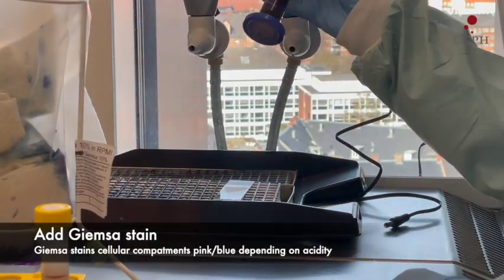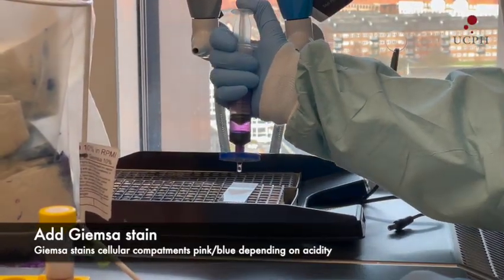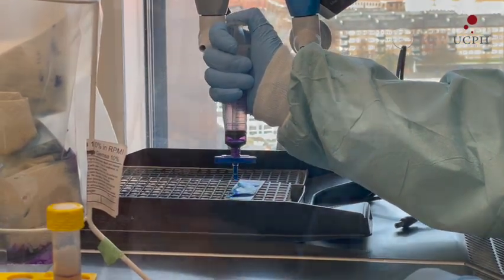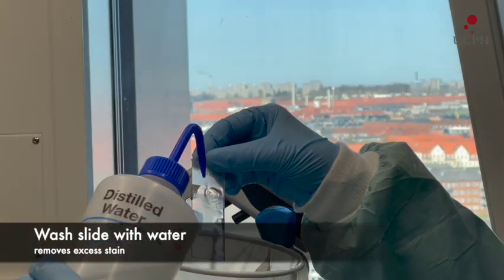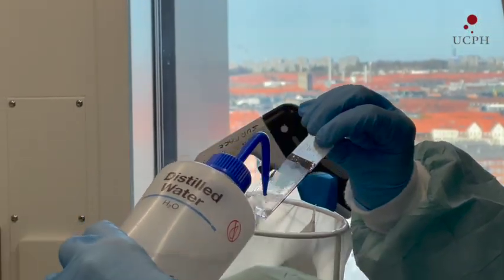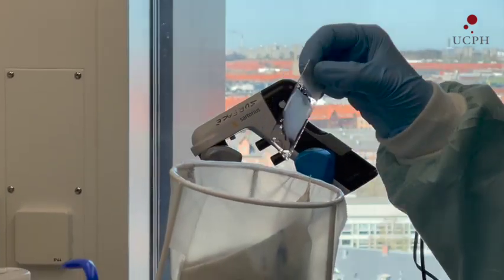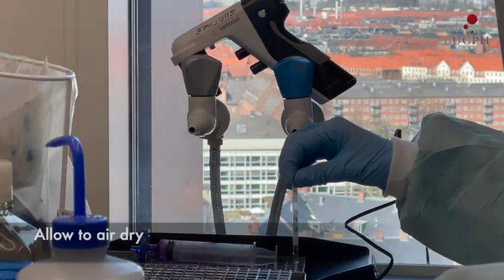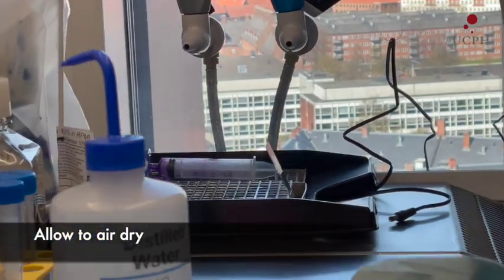Parasites can be visualized by staining with Giemsa. Then allow to air dry.